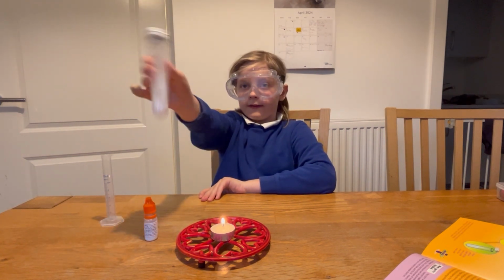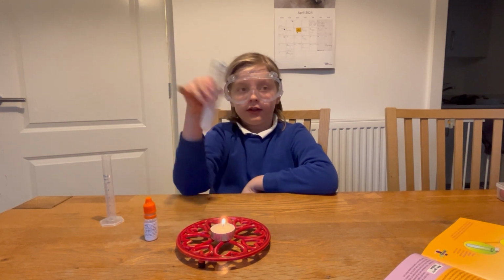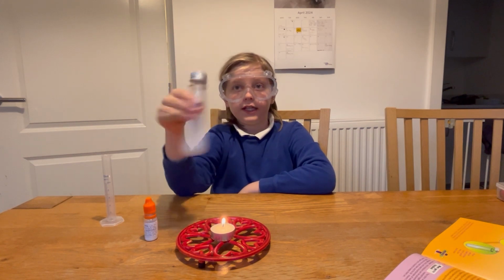Why are you shaking it? To dissolve it. And why does shaking it help it dissolve faster? Because it's applying more motion and friction, which causes heat.